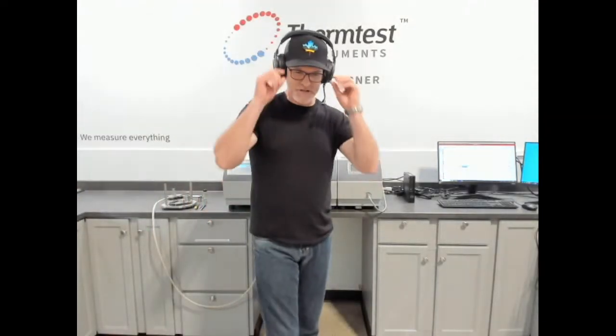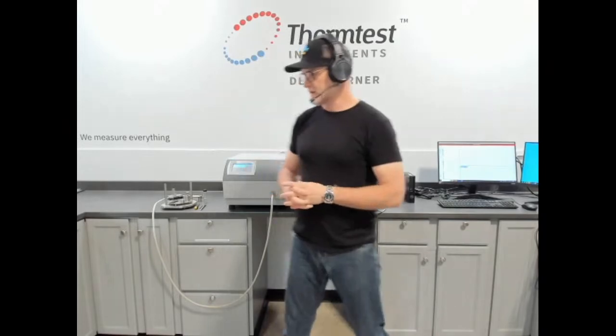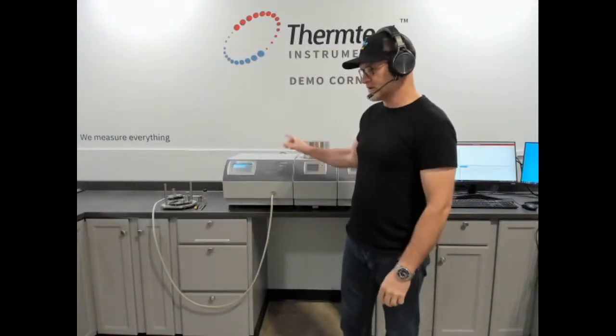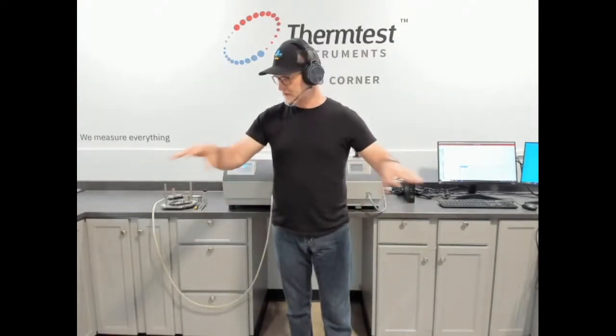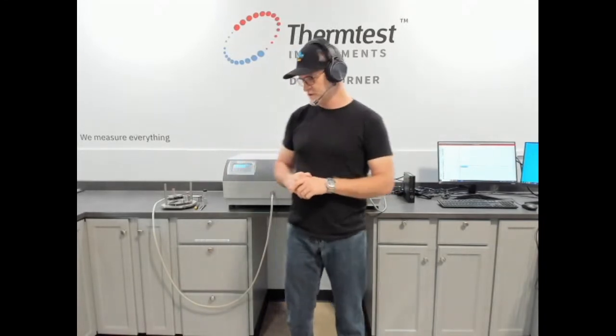Welcome to the demonstration corner. Today we're going to talk about measurement of powders by the transient plane source method that is available on our MP1 and MP-V. Classic here, we're going to talk about the methods that are available in our demonstration corner and a little bit of information on each one, and we'll get into the demonstration.